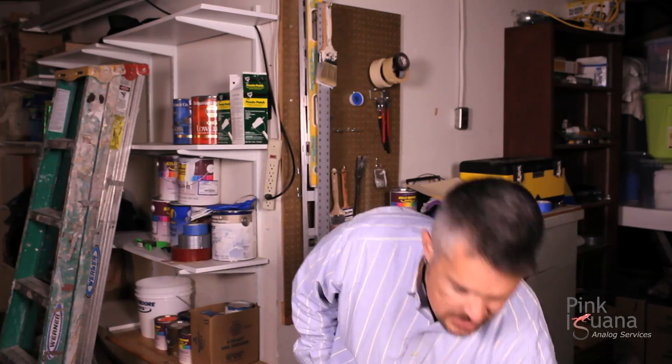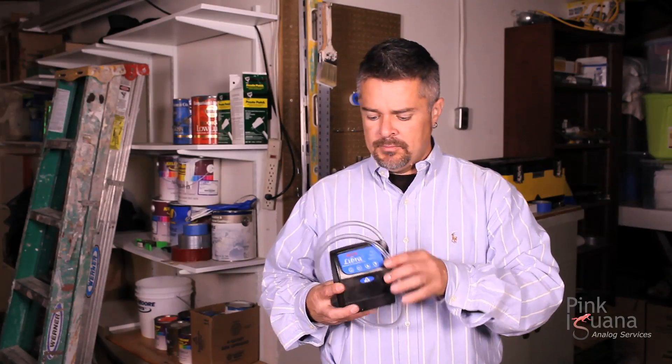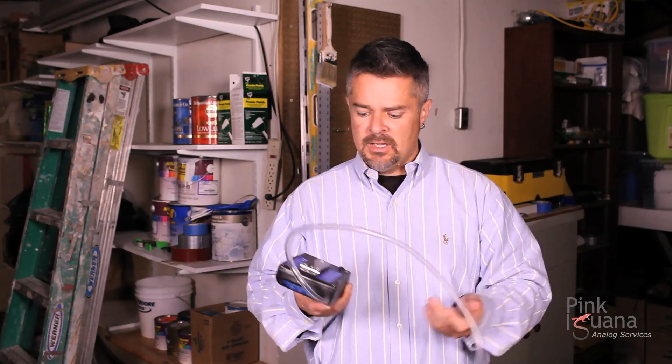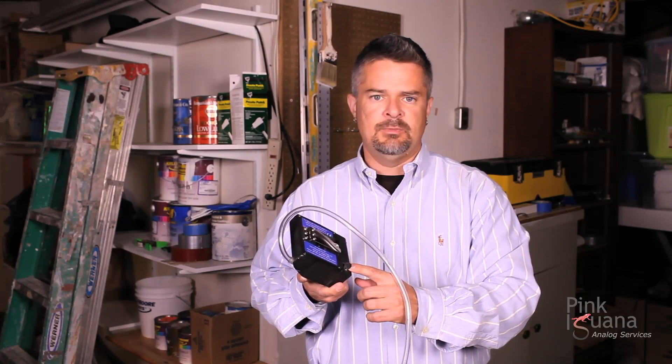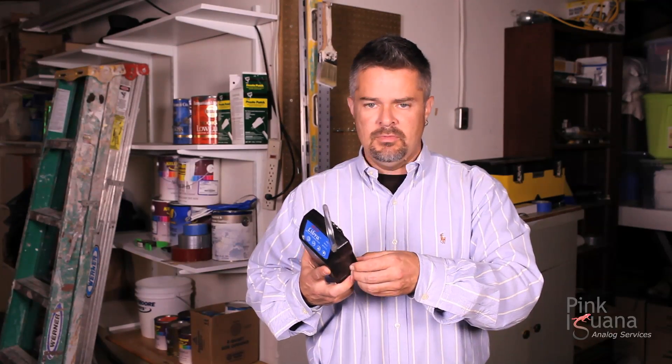It starts with the pump. The pump that I use is a Buck Libra pump. It's little more than a fish tank pump, but it's specifically calibrated for use in measuring air quality for your employees. It's got some hose attached to it and a power cord attachment so you can power it up. The power is usually good for about 12 to 14 hours.